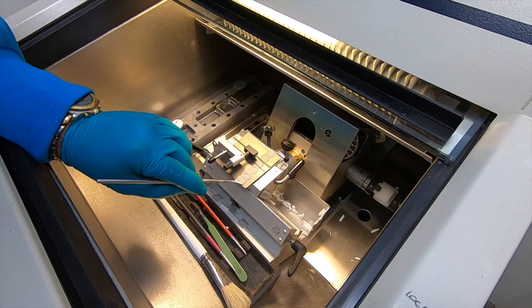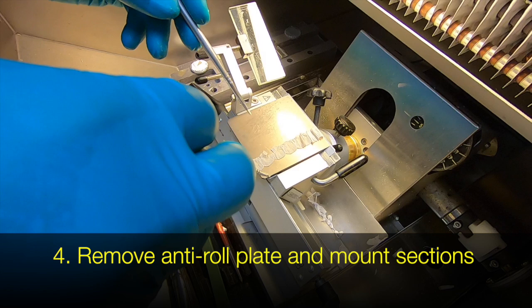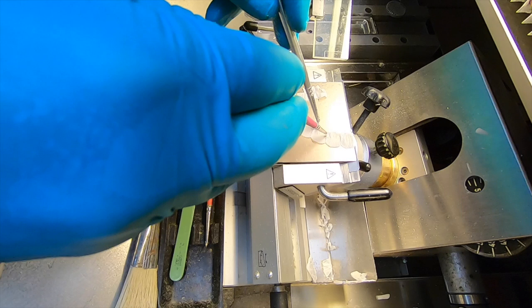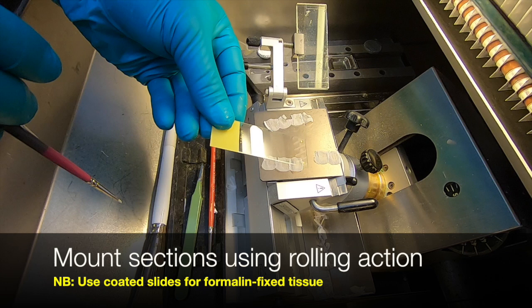Chris now continues to cut a few more sections until there's a nice ribbon. We then remove the anti-roll plate and, using a couple of paintbrushes, very carefully dissect those sections within the ribbon so that we have 2 to 3 pieces each. Then, grabbing a microscope slide and using a rolling-like action, you'll see the sections adhering onto the glass.